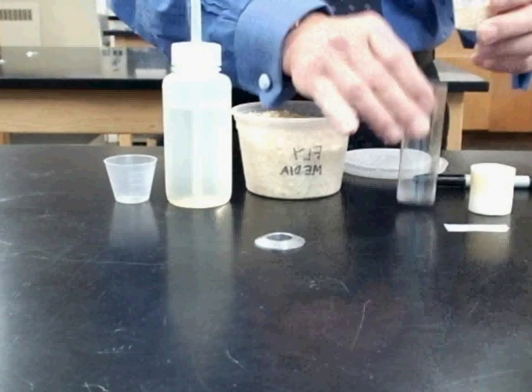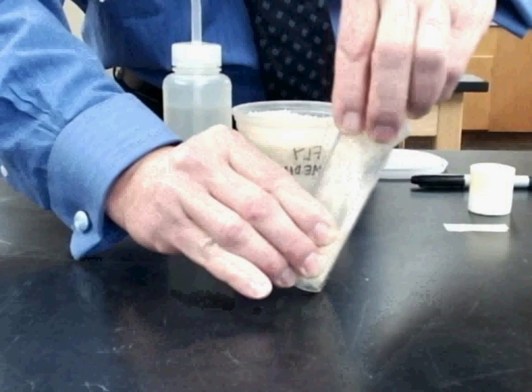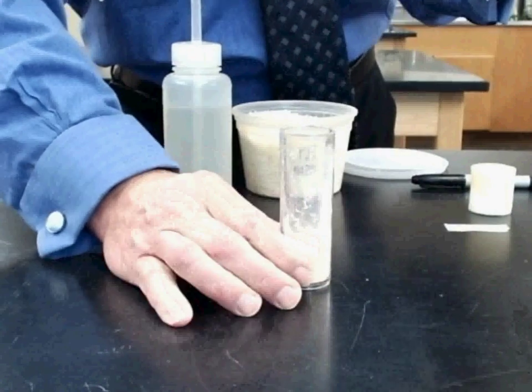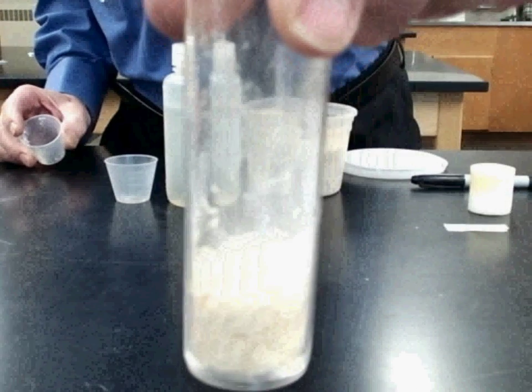Alright, once you have about a half a cup, you're then going to pour it into the vial. And you see you have about that much in the vial.